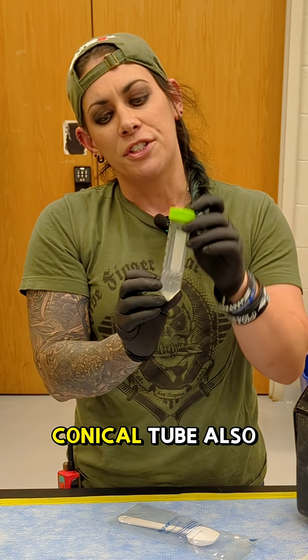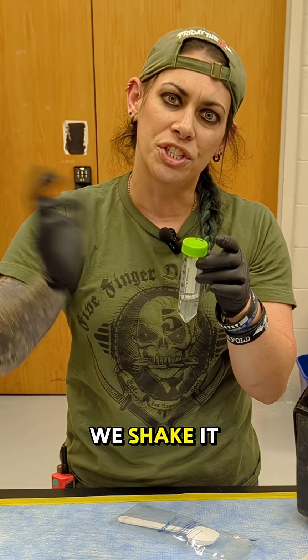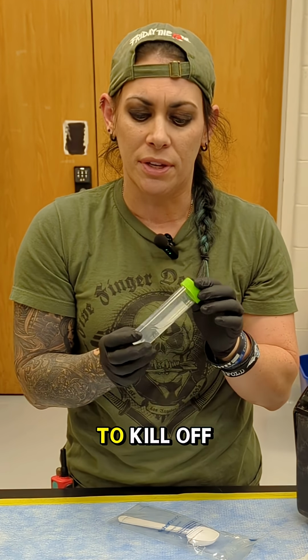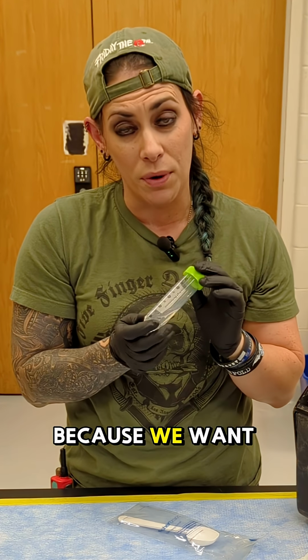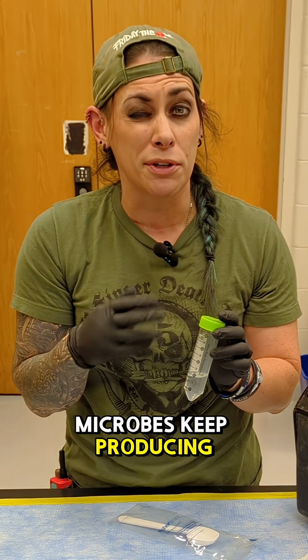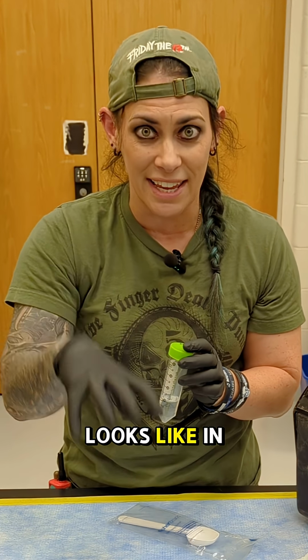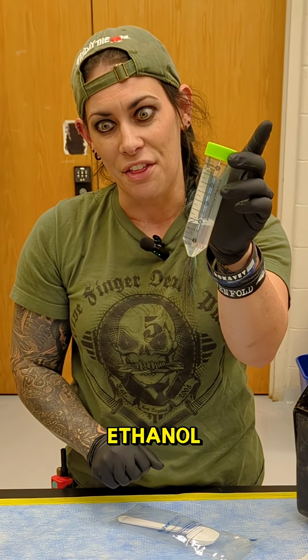This 50 milliliter conical tube also contains 70% ethanol. We throw the sediment in here, we shake it up, get that ethanol all in the sample to kill off any microbes in there because we want to know metabolites with these. We don't want the bacteria or microbes to keep producing metabolites when we're in transit. We don't want that to skew our results. We want to know what it looks like in the cave. So that's why we have it in ethanol.